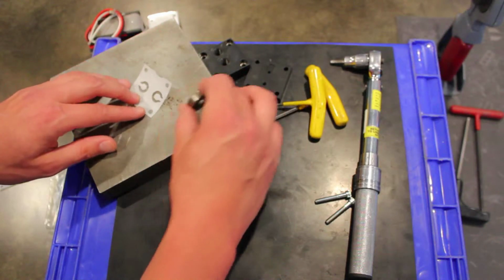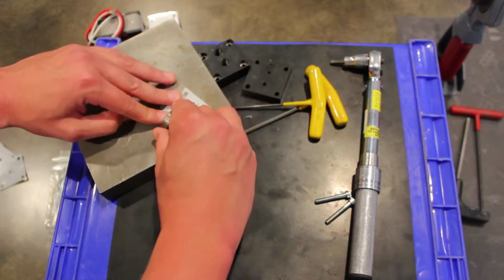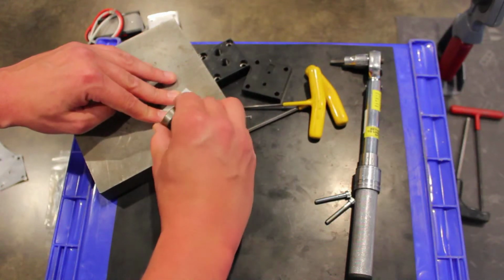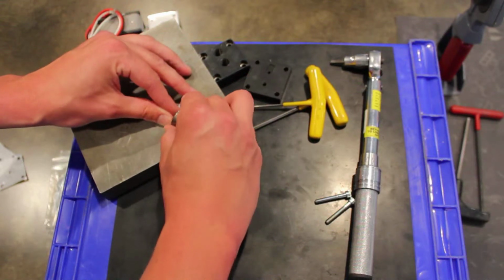Really important, you don't want to go back and forth on it because that can stretch the gasket in the wrong way. So just right away from us, just press down, really nice and smooth. We'll flip it over and get the other side.